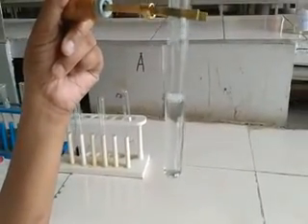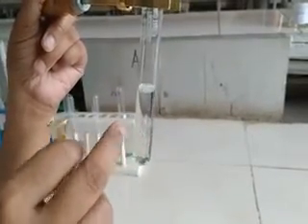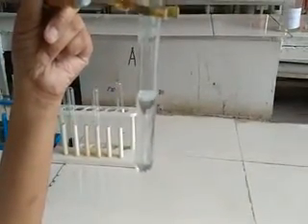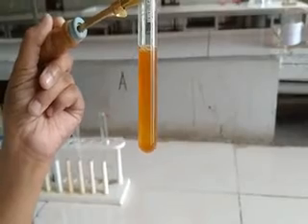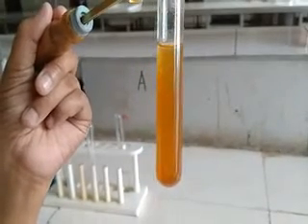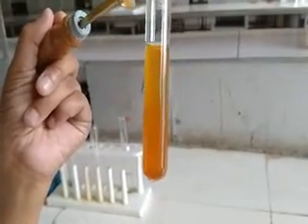Now we will do the test for phenolic OH group. I have taken alcoholic solution of the provided organic sample and will add neutral ferric chloride solution to the mixture. As you can see, no purple-violet coloration has been formed, which infers that the given organic sample does not contain a phenolic OH group. As the phenolic OH group is absent, we will not carry out the Liebermann nitroso test, which is the confirmatory test for phenolic OH group.